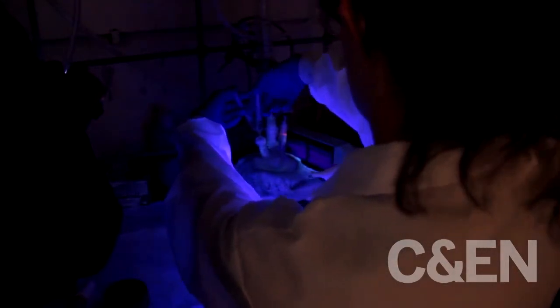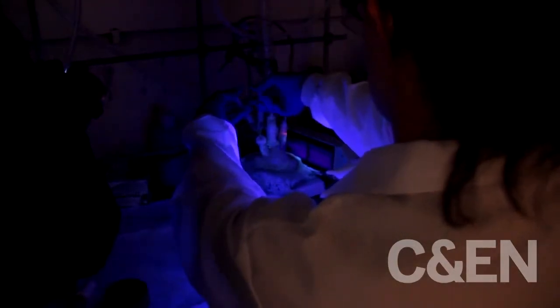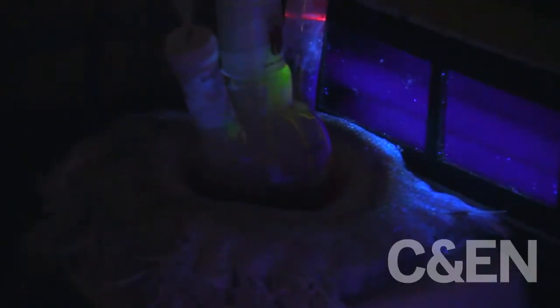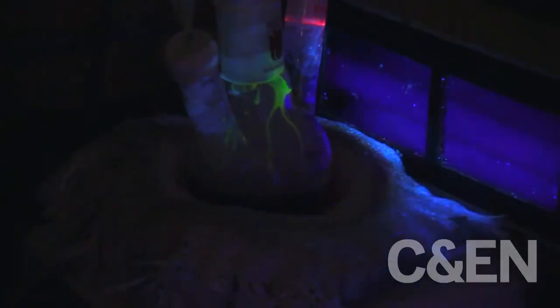So now I am injecting the selenium and you can see the color changes immediately. I'm going to lower the temperature to 290 degrees to anneal it. You can see in the beginning it fluoresces green, but as it heats up it turns to a more red color.